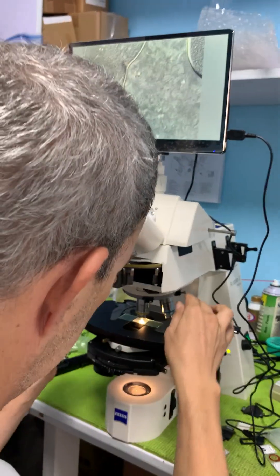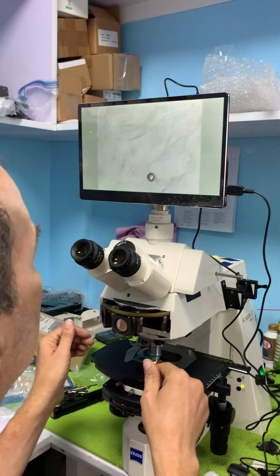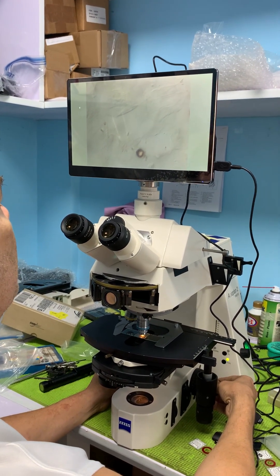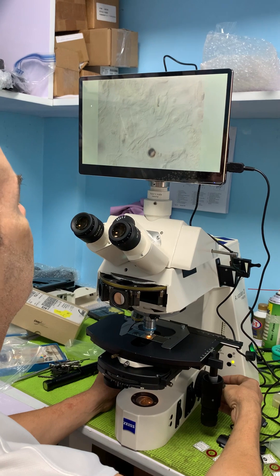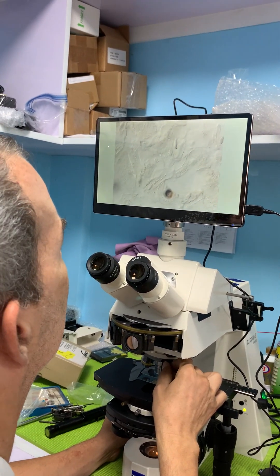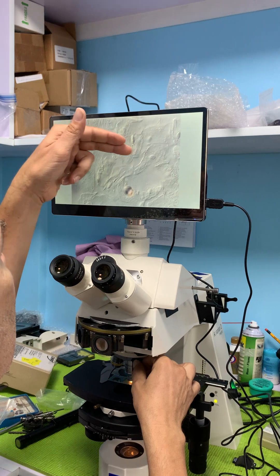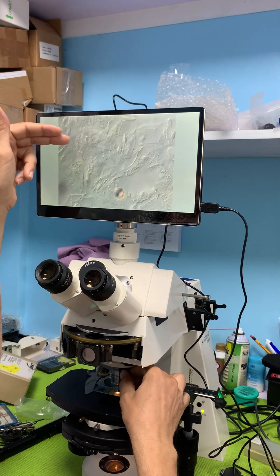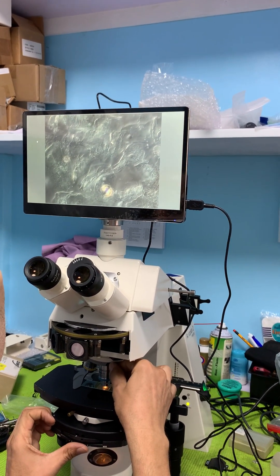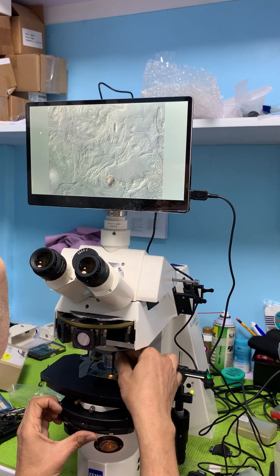Let's turn it back to the 40x. I don't have a 40x phase on here right now — I could put one on, I've got one in a box next to me, but it's not what I grabbed when I set this up. On the 40x DIC, the nuclei are really showing up with good fine detail.